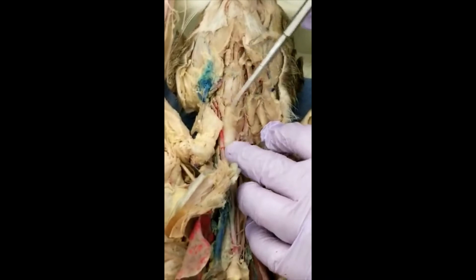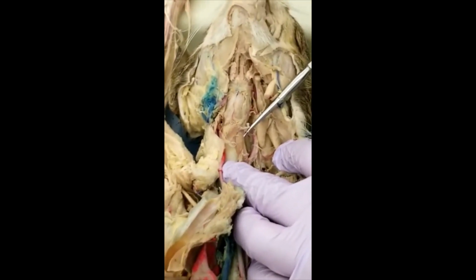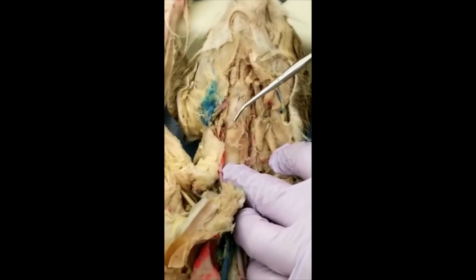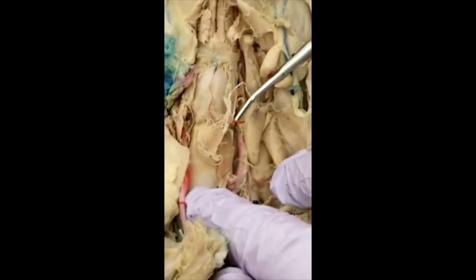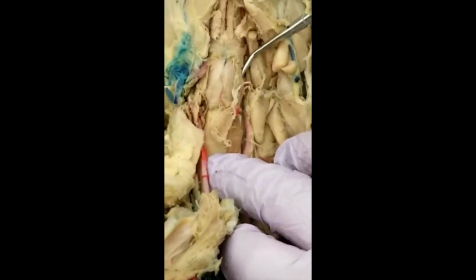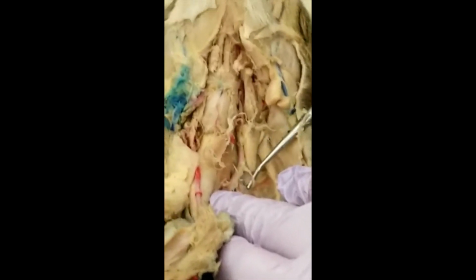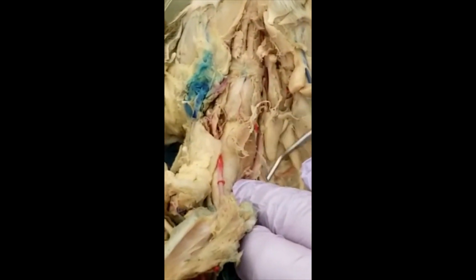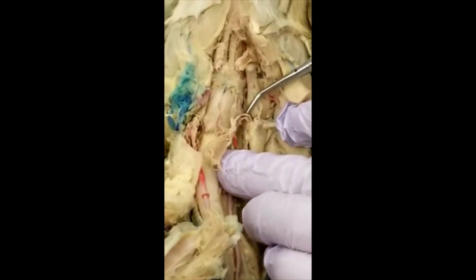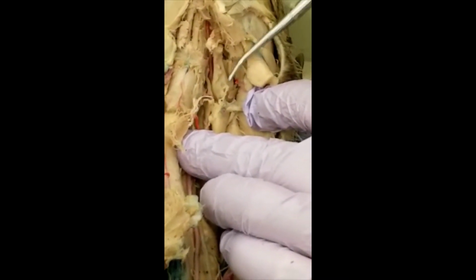So you get into here, you have the thyroid gland over here. Can you see the thyroid gland? This piece, which is damaged over here, can you see that? This is the superior thyroid. And this one going to the side, you see this? This is muscularis. Then the laryngeal is not damaged, you see that? This is the laryngeal.